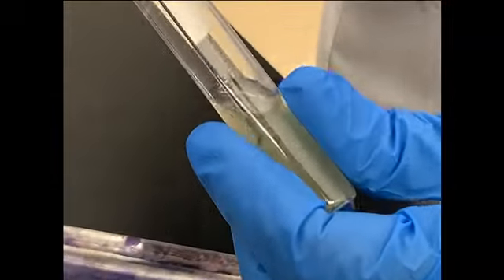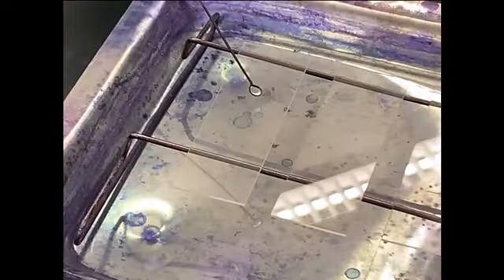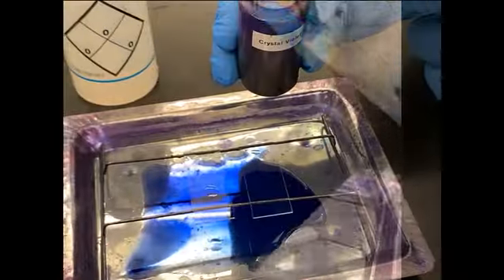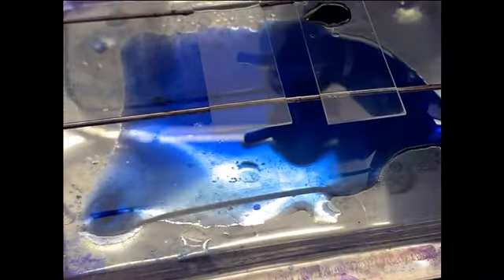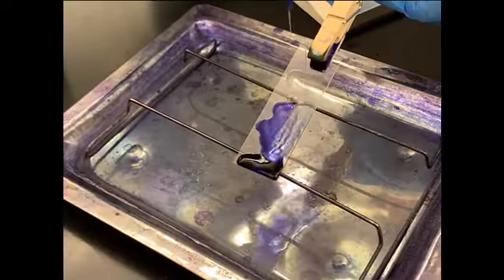As with most staining procedures, you will start with a smear. Spread a thin layer of bacteria on a clean slide, allow it to completely air dry, and then heat fix it. For the gram stain, you will first flood the slide with the primary stain, crystal violet. Allow it to stand for one minute, and then gently but thoroughly rinse the slide.